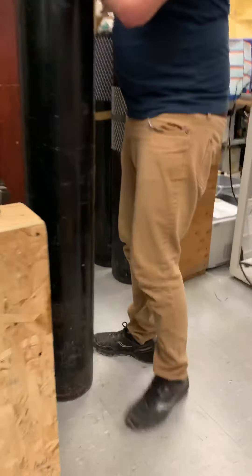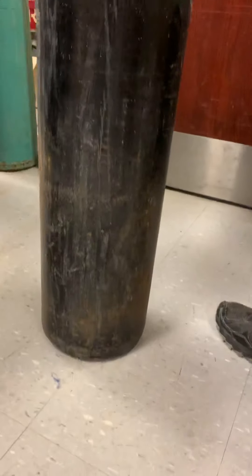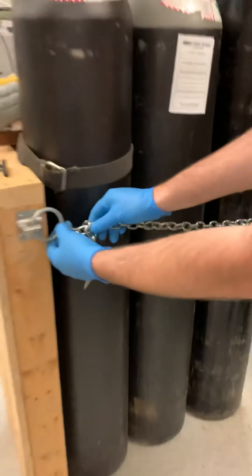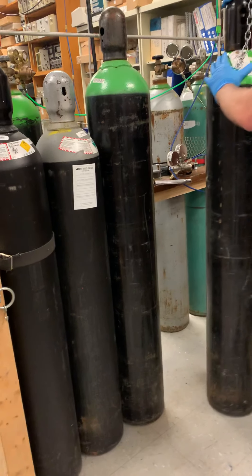With this rolling, you can see you kind of roll it right on the edge. Very, very small motions. Put that one in place.